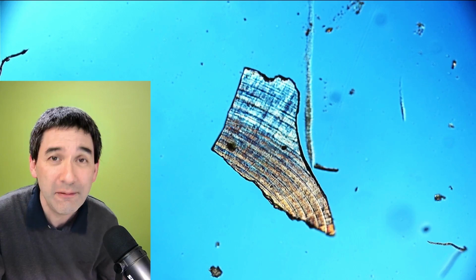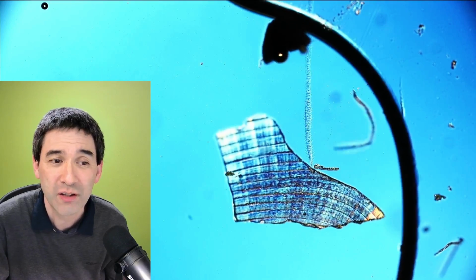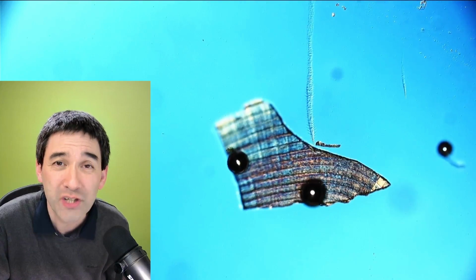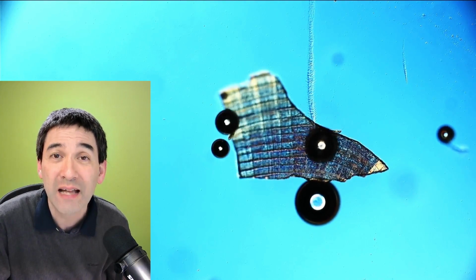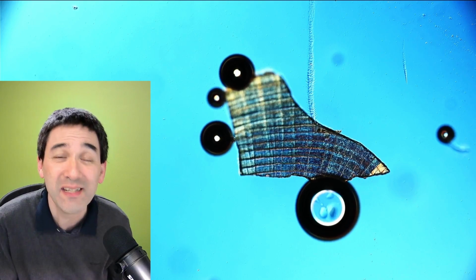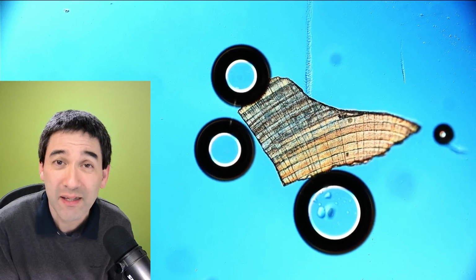And watch now on the left side as the acid approaches. You can see that it slowly approaches, and now it covers the whole thing. And immediately you can see that there are bubbles appearing. Do you see those bubbles? These are carbon dioxide bubbles, and this is evidence that we have a chemical reaction happening, and that the acid breaks down the calcium carbonate from this little fragment. We now have evidence that this is made of calcium carbonate, and it's most likely a fragment of a clam, a seashell.